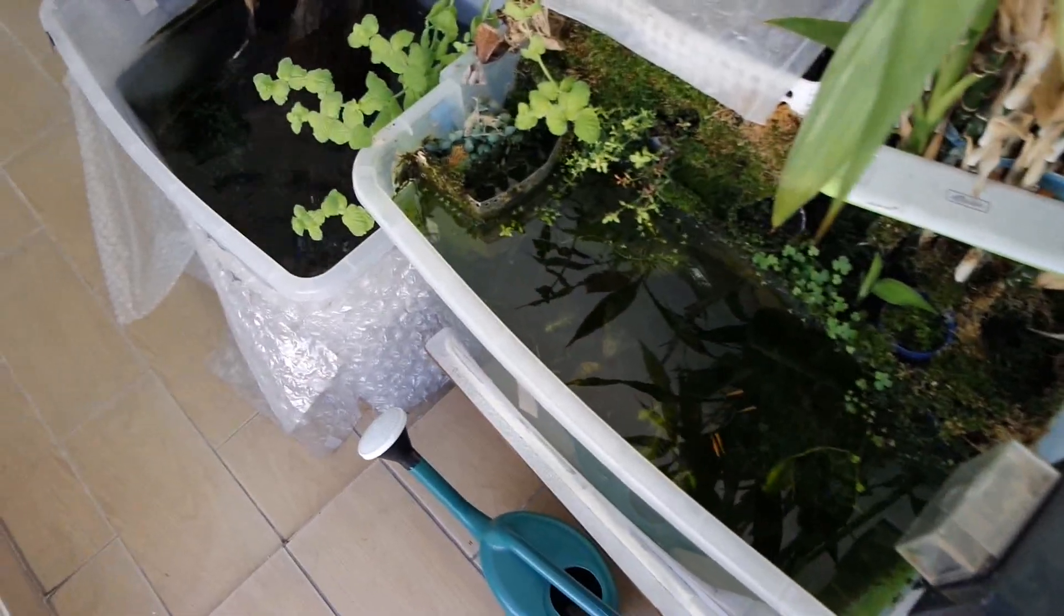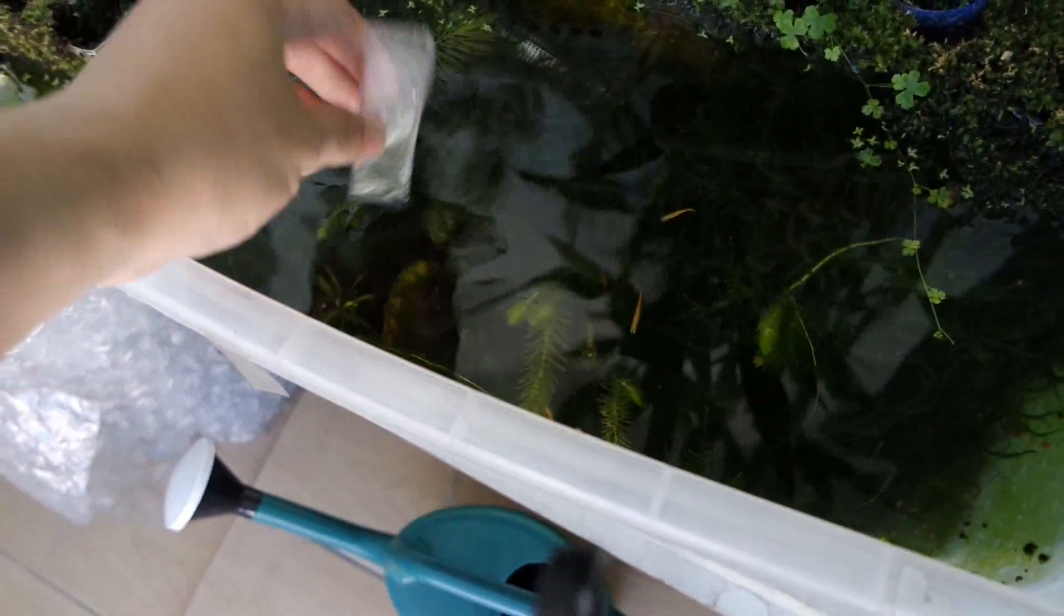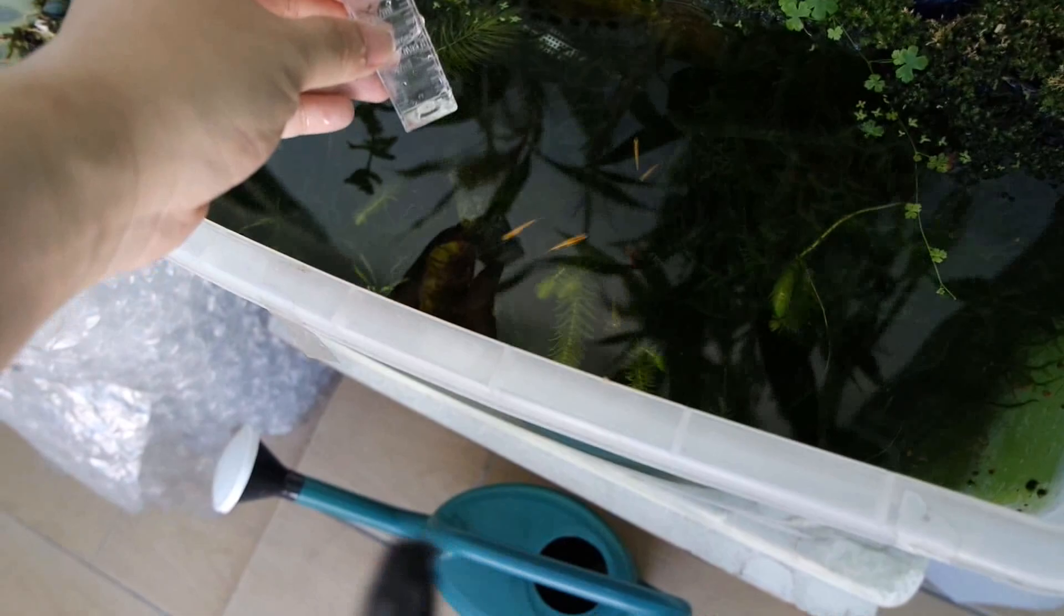Moving on. Okay so next up is my turtle tank. I will be taking a little bit of water there. Okay same thing again.